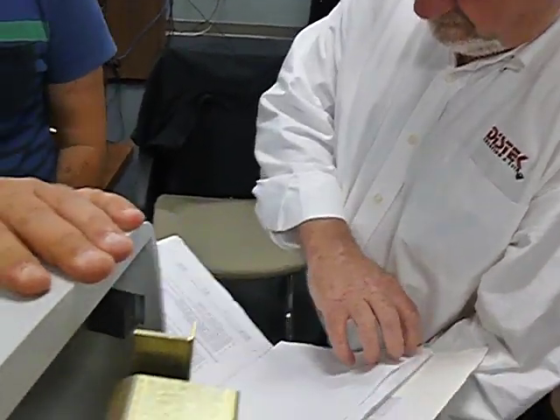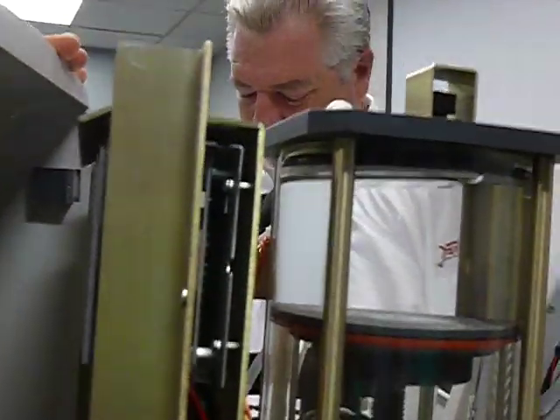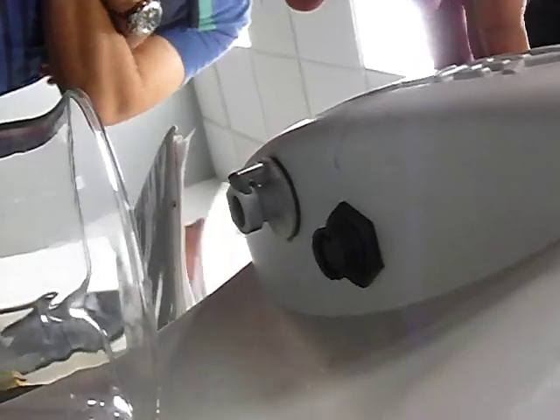Maybe it's not completely sealed? So 500 milliliters, it was entered. There's still air in the chamber. It was entered 500. Now I can't show it. Yeah, it was pre-entered. But you can change it. You can change any volume between 250 and 1,000.